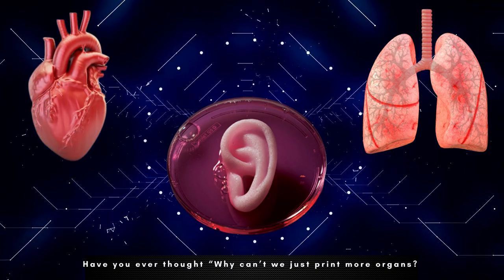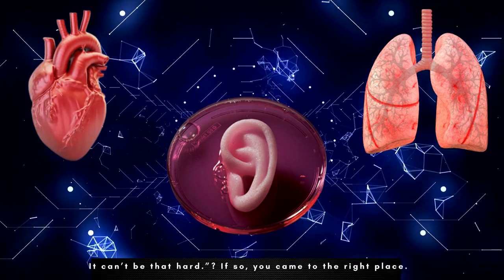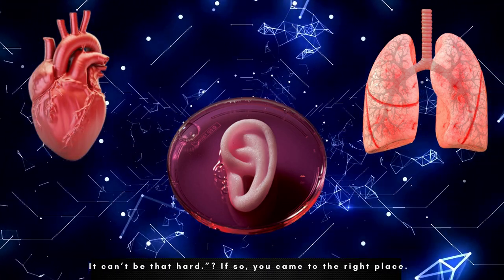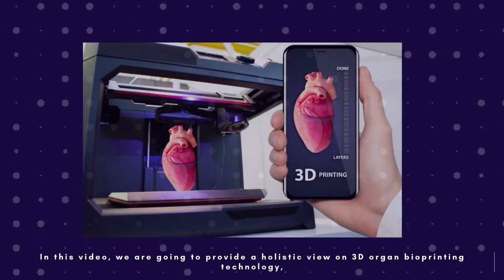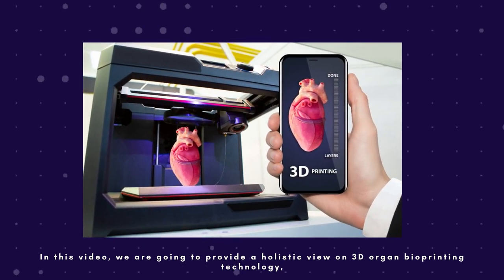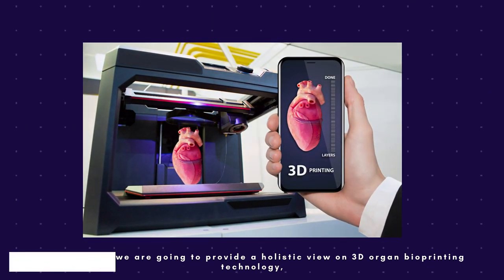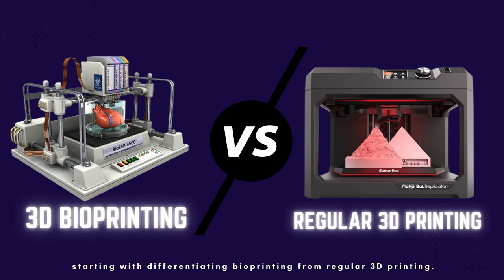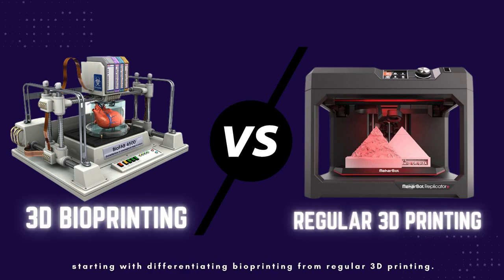Have you ever thought, why can't we just print more organs? It can't be that hard. If so, you came to the right place. In this video, we are going to provide a holistic view on 3D organ bioprinting technology, starting with differentiating bioprinting from regular 3D printing.